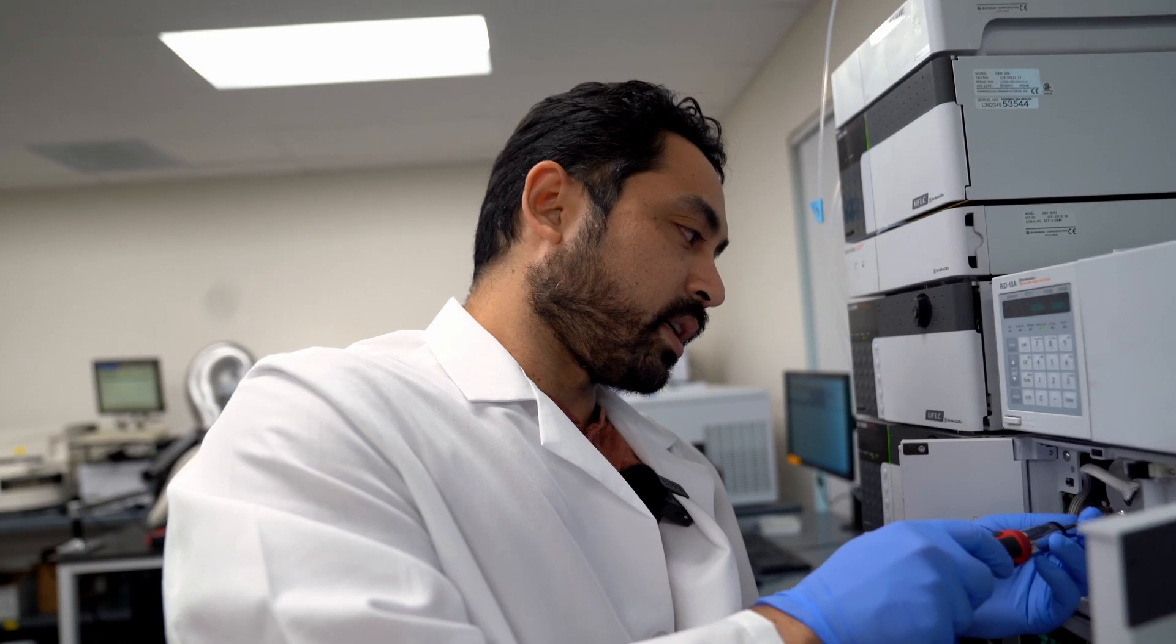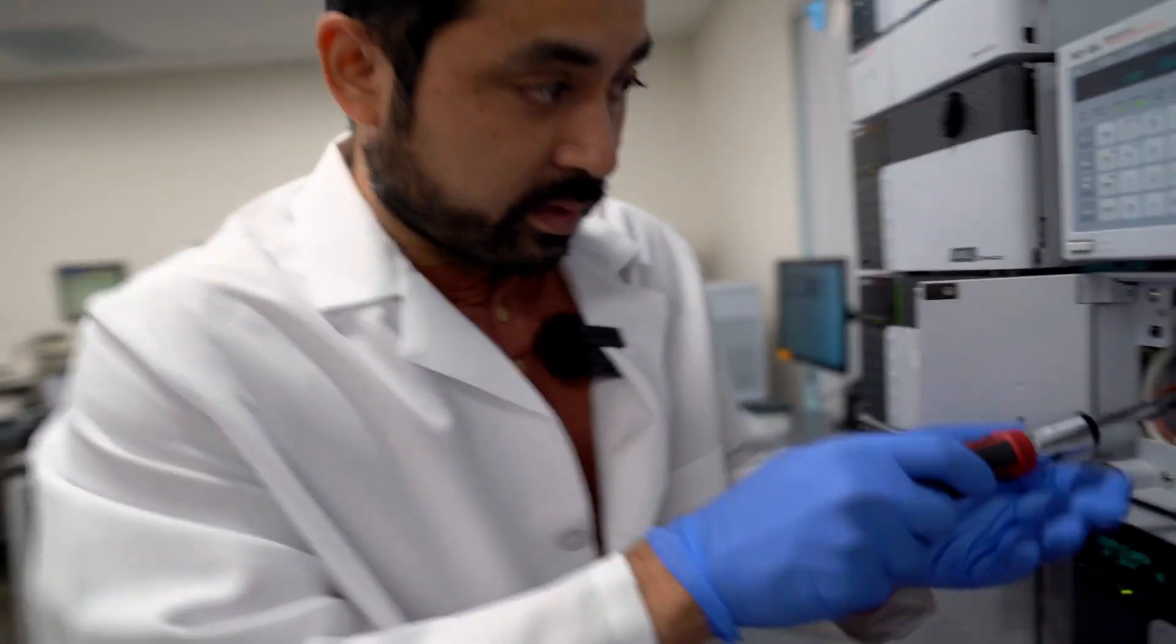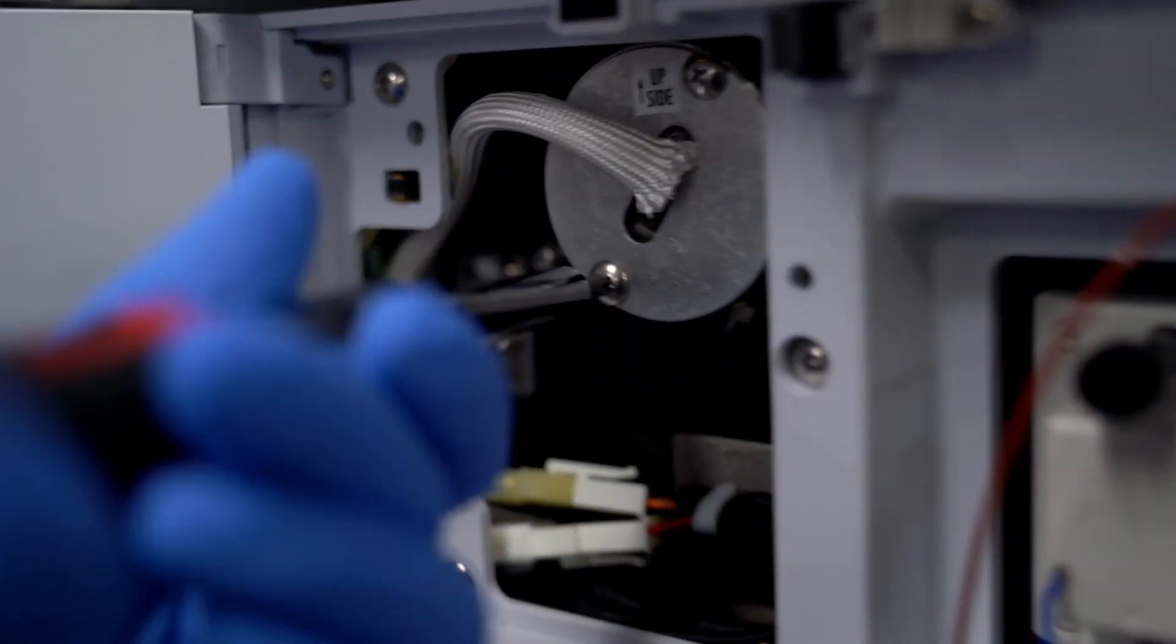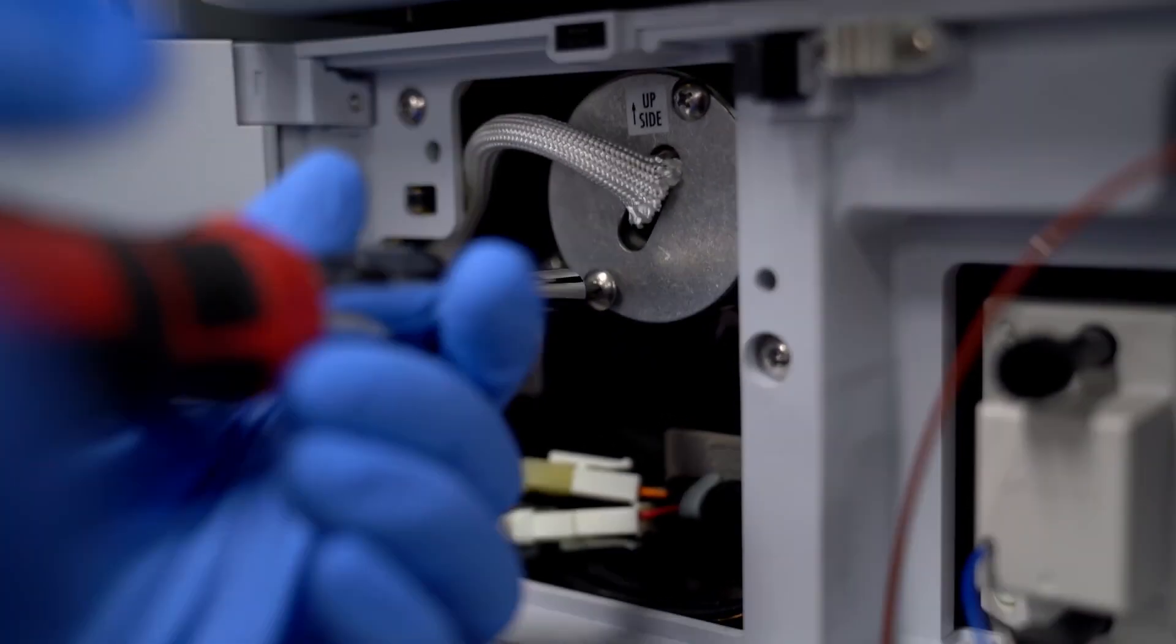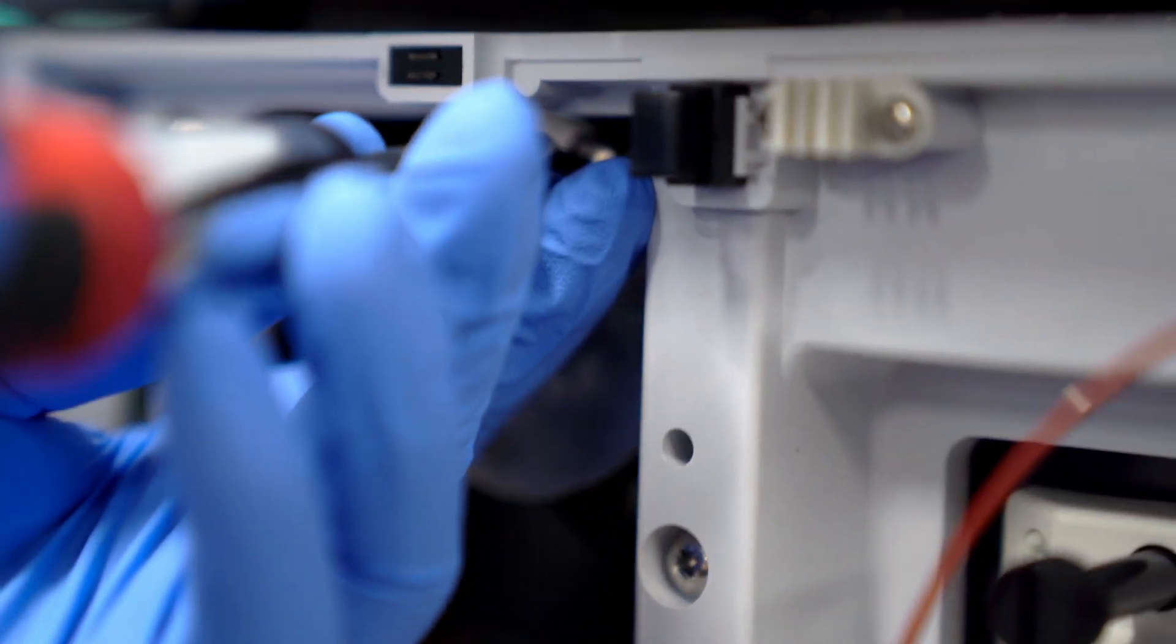The D2 lamp is a little bit more troublesome. You've got to take off these screws over here, but you don't need to take the screws completely out - you could just loosen them, and then this one, and then this assembly should come out.